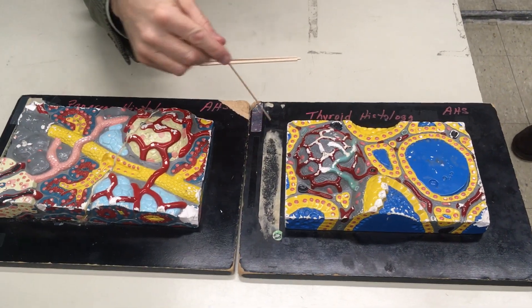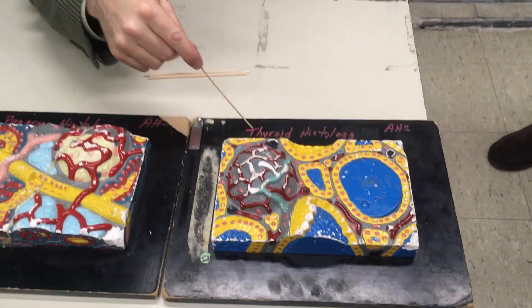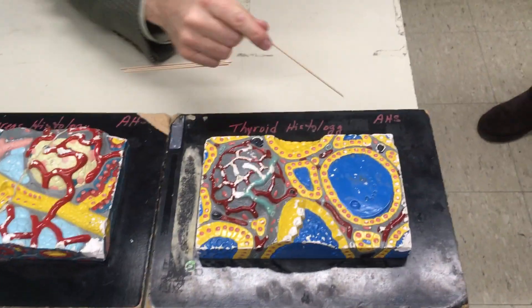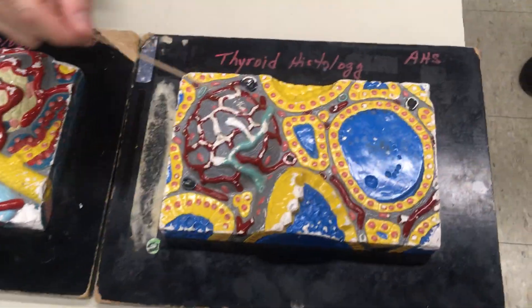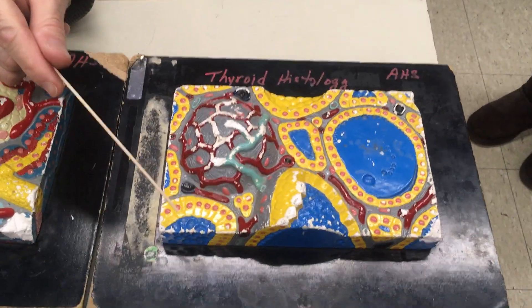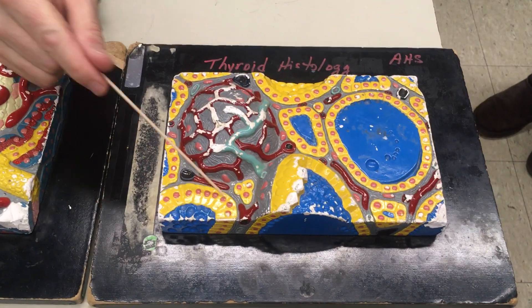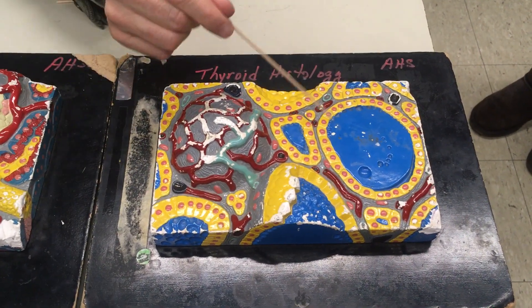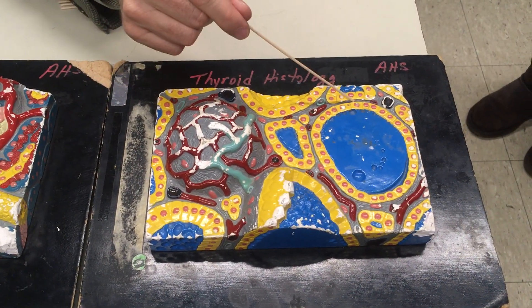We're going to do histology of the thyroid and pancreas. Starting with the thyroid — this is a follicle. There are multiple follicles here. All of these structures are known as thyroid follicles.